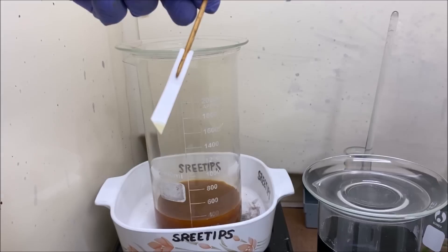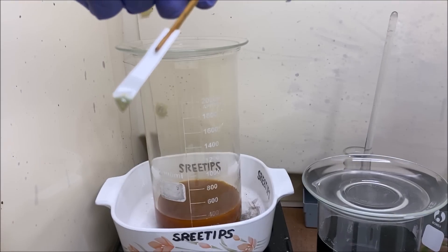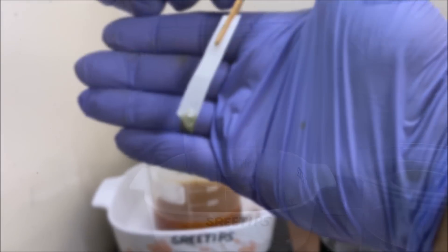It's been on boiling nitric for a little while now. I'll get some on a filter paper and do a stannous test. I see green — this means palladium in solution.